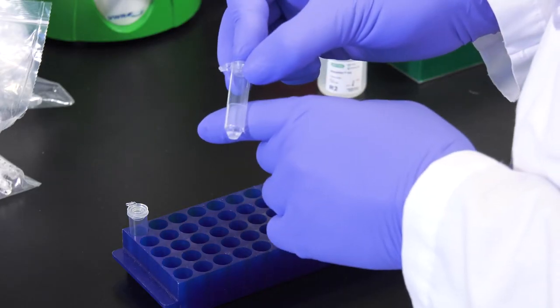You now have 100 microliters of extracted purified DNA. The extracted DNA can be stored at minus 20 degrees Celsius if required for several months.